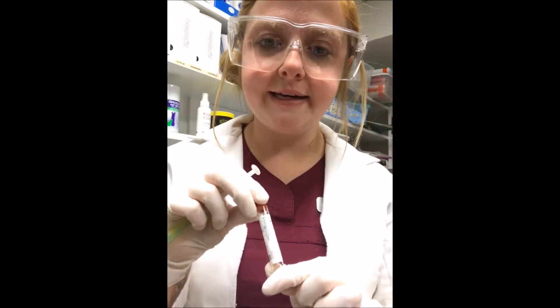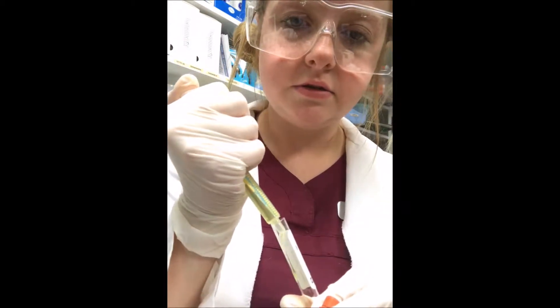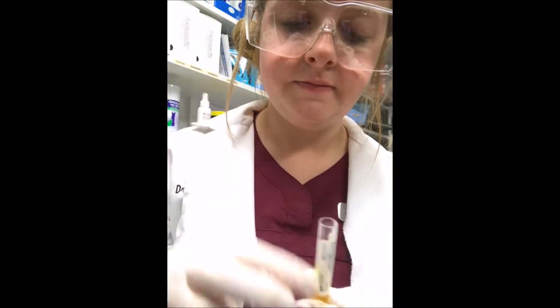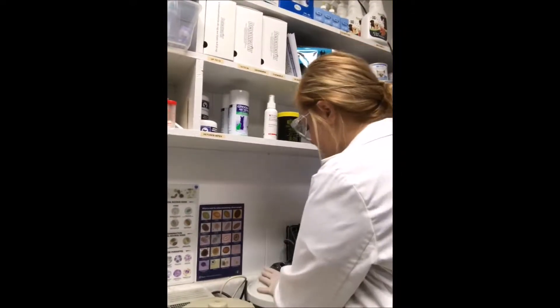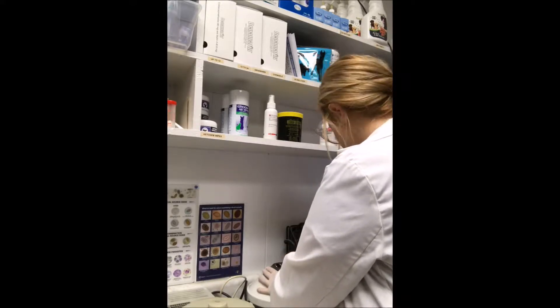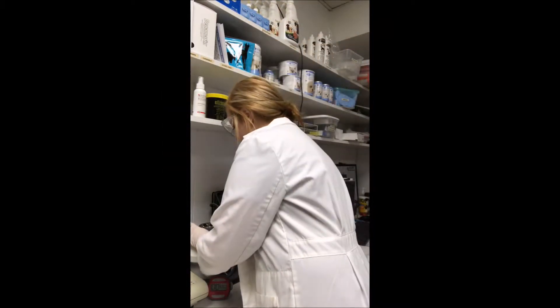I have a plain red top tube with no additive and I'm going to put the urine into it. I'm going to put it into the centrifuge and let that sit for 10 minutes. The centrifuge has been spinning for 10 minutes, so we're going to get out our urine.